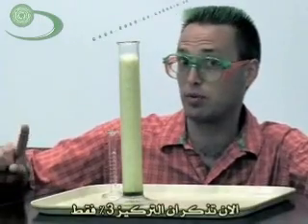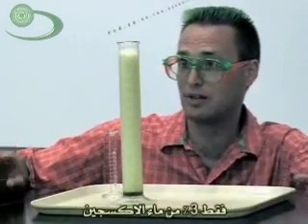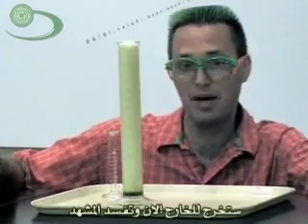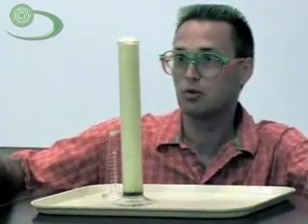This is 3% hydrogen peroxide. It's still foaming and it's going to make a mess now.